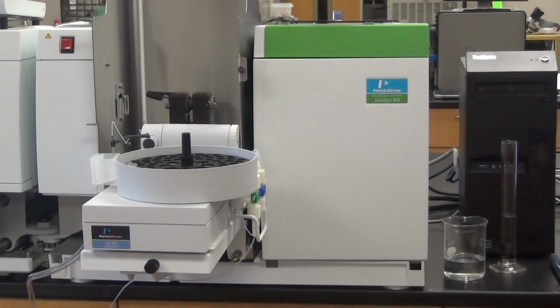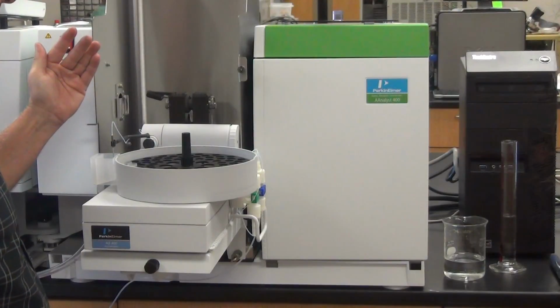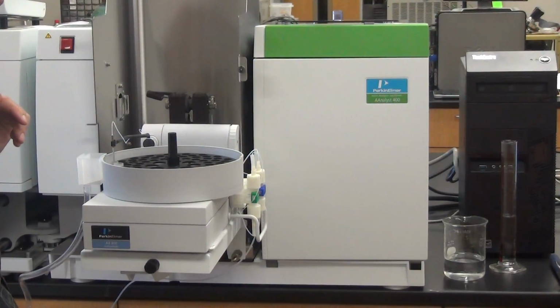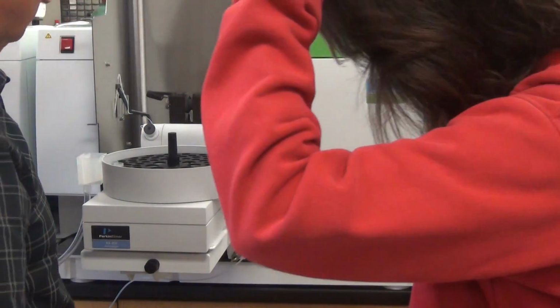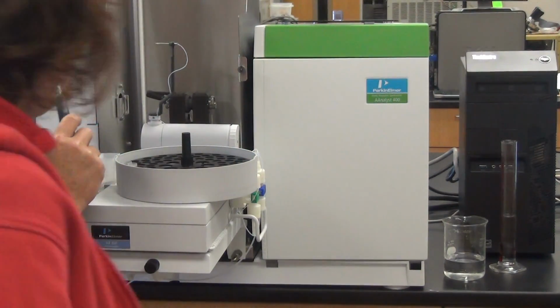See what it's doing. It will come in and pick up the sample, and it will sit here. And when it does, it's doing the baseline offset correction. You remember what those are? It's just looking at the intensity of the lamp, because it has to project it forward. Right there's when it's doing it. You cannot have a mirror up there watching it put its injection in. If you want to watch it put the injection in, you're going to come over here right now. Alright. And it went in, we didn't bend anything, so A-okay.